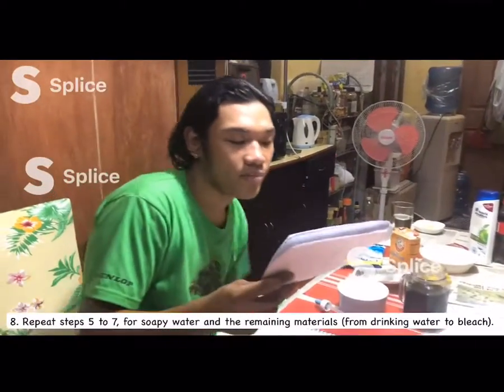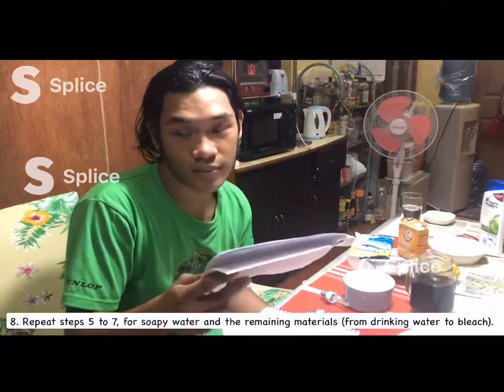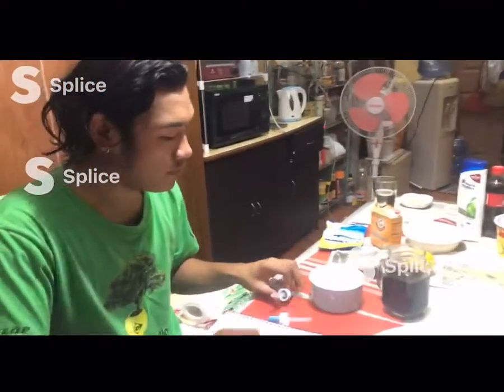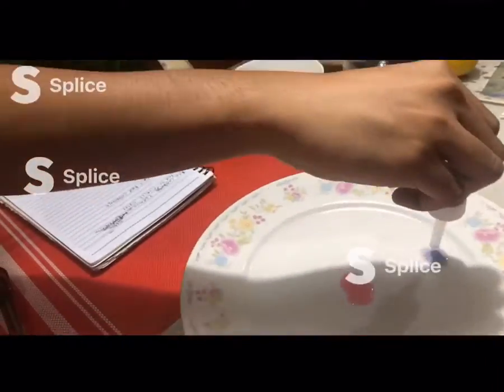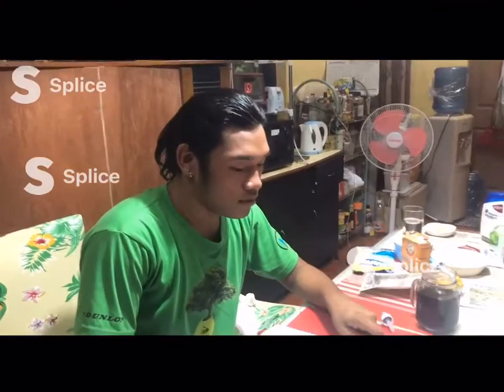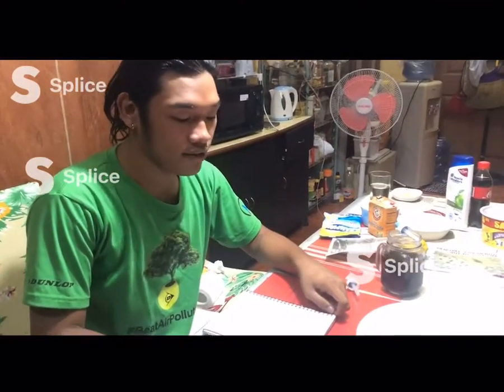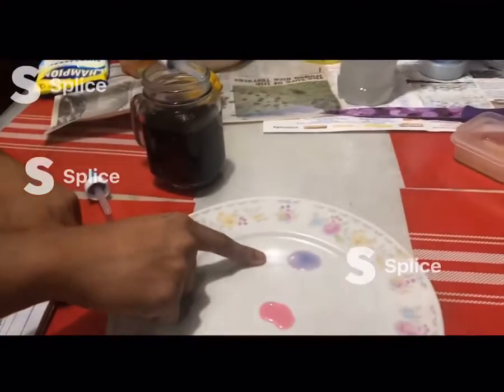So now I will repeat steps 5 to 7 for soapy water and the remaining materials from drinking water to bleach. I notice when I mix the soapy water and the red cabbage juice, it turns into a violet color.